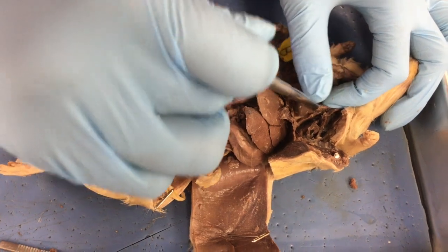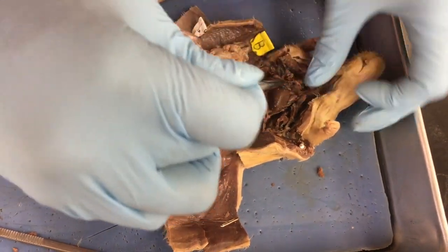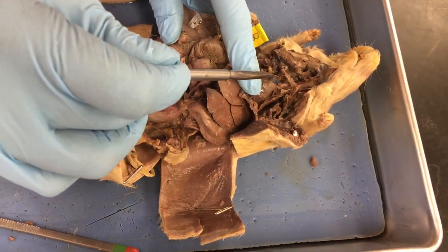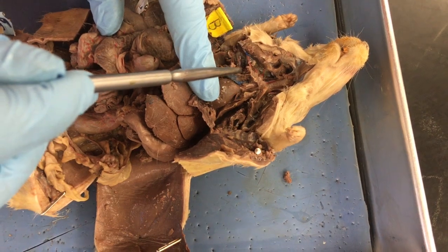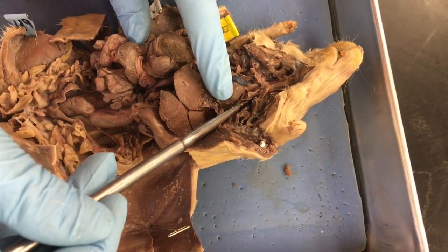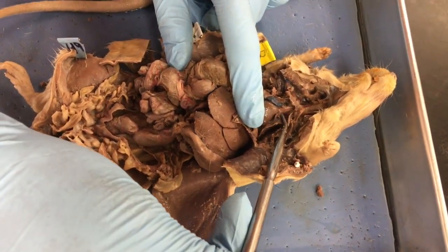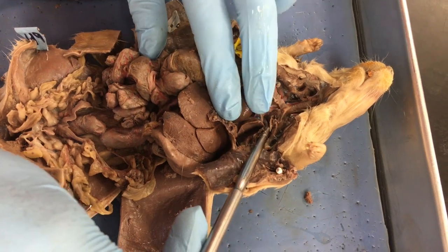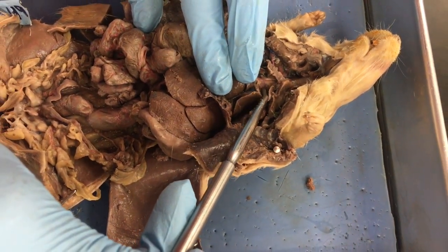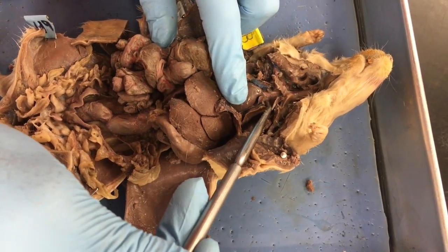Anyway, we have the heart. So you have your heart there. And at the top, this is your heart, and this blue structure right here, that's just one of the ventricles. And then we have the auricles up top of there. And this structure right here is the aortic arch. Can you see how it's doing an arch type thing? There it goes. So atria, ventricles, aortic arch.